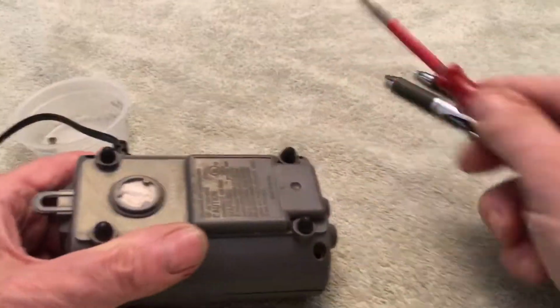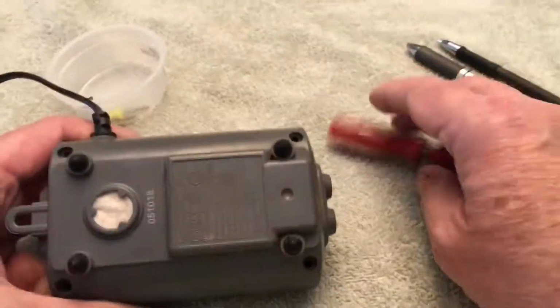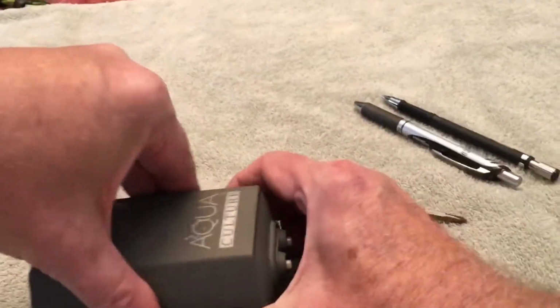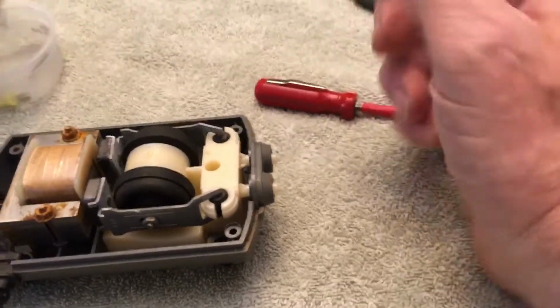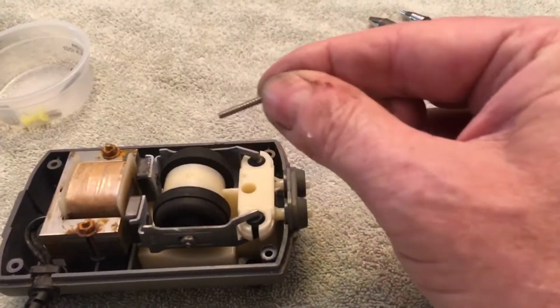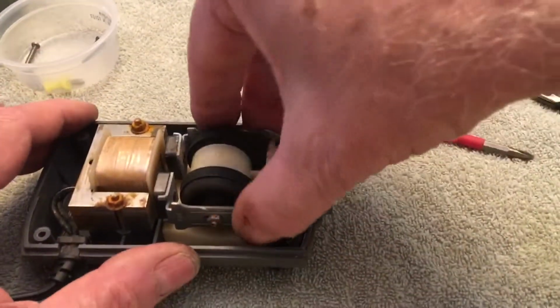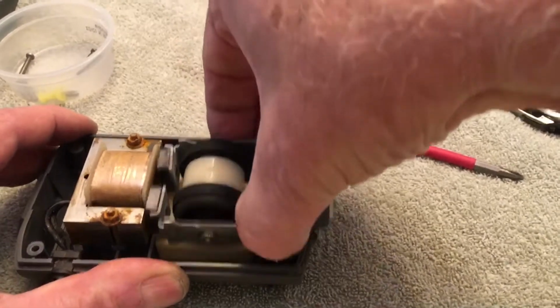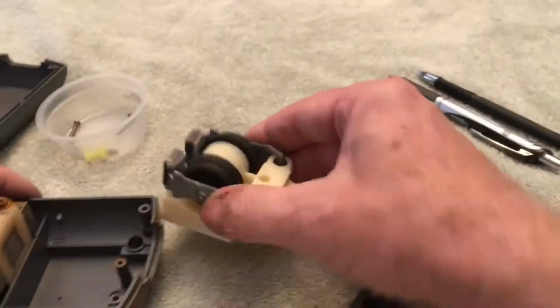There's 4 screws on the bottom. I've already taken them out. You just pop the top. There's also a screw in here. They're all the same size, so you don't have to worry about which screw is which. Once you do that, this unit will lift out. If it's an older pump, it'll be kind of stuck. You'll have to wiggle it and work it.